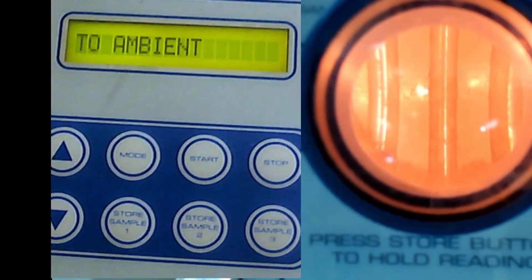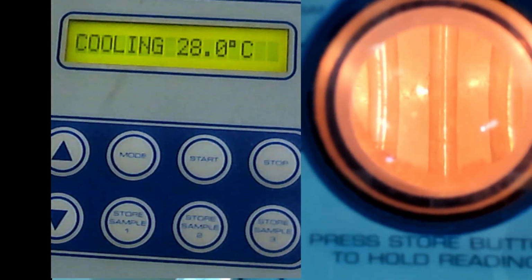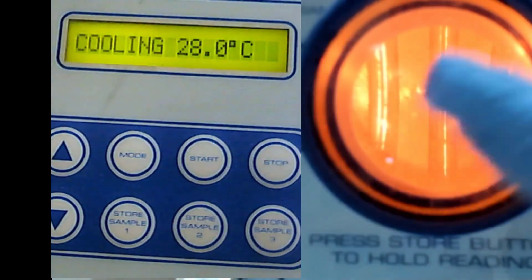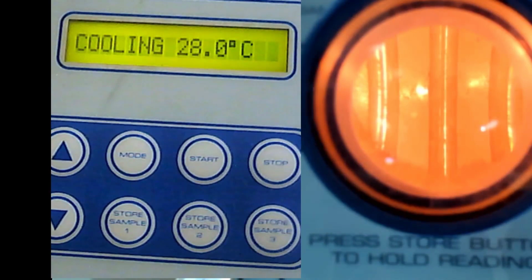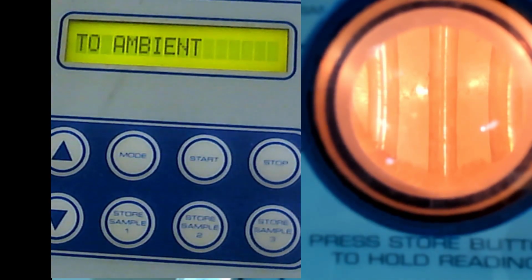Okay, so now I want to insert our capillary tube with the sample inside. If you see, there are three holes there: 1, 2, 3. So let's say I want to put in the middle hole. Just now you saw there are holes on top of this machine, right? So I put it in hole number 2. Where is the hole?